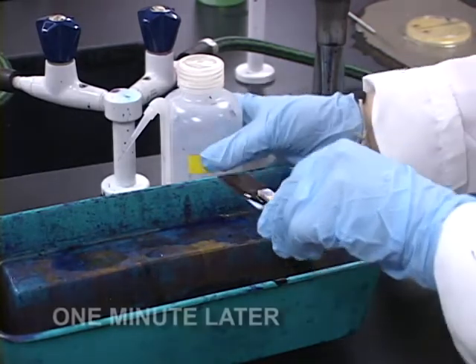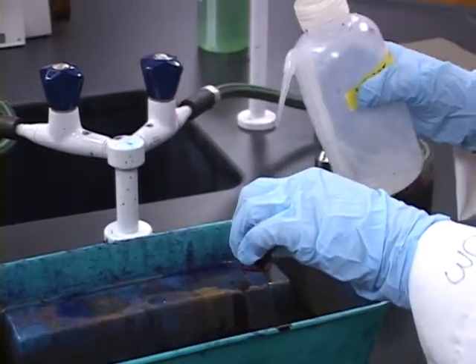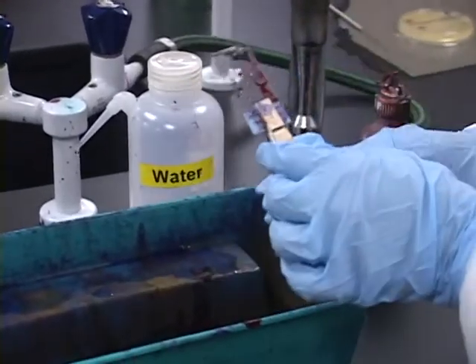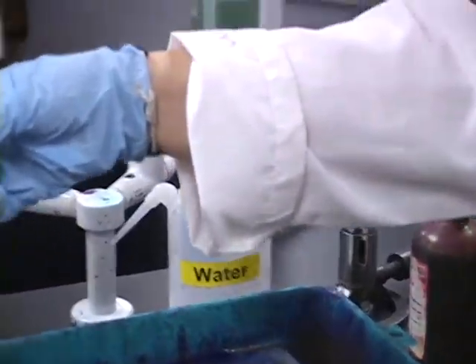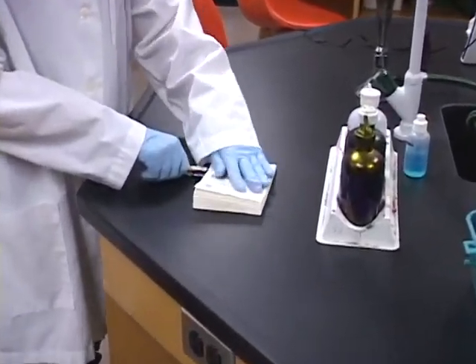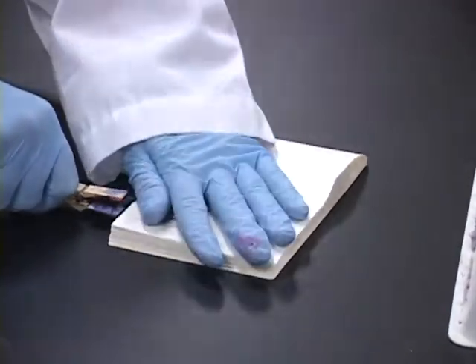Okay, after a minute, you're going to rinse the slide for 5 seconds. After completion of the water rinse, Sam's going to show you what you're going to do next. Next, you're going to blot it dry on bibulous paper, but be gentle because you might crack the slide. It has been done before. It may take a couple of blots before you get it dry enough.